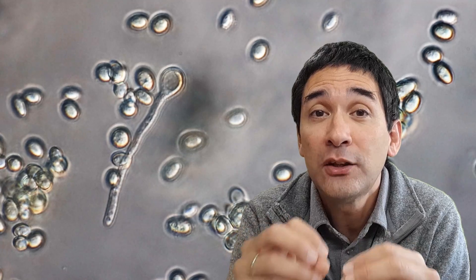Under the microscope, you see those regular structures, and those spores are able to spread through the air — that's why we're also able to inhale them. When they land on a suitable medium like on the ground or on another fruit, they're able to germinate. This means they're able to grow and form cells which form a dense network of cells called the mycelium of the fungus. The mycelium can be seen under the microscope quite easily because you see many thread-like structures — many long cells — and that is actually the main part of the fungus.